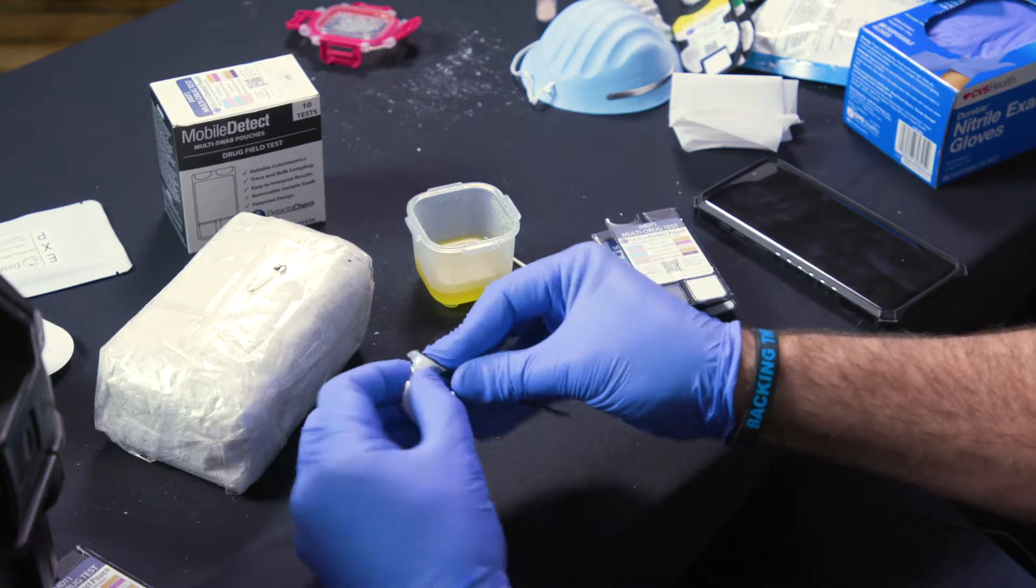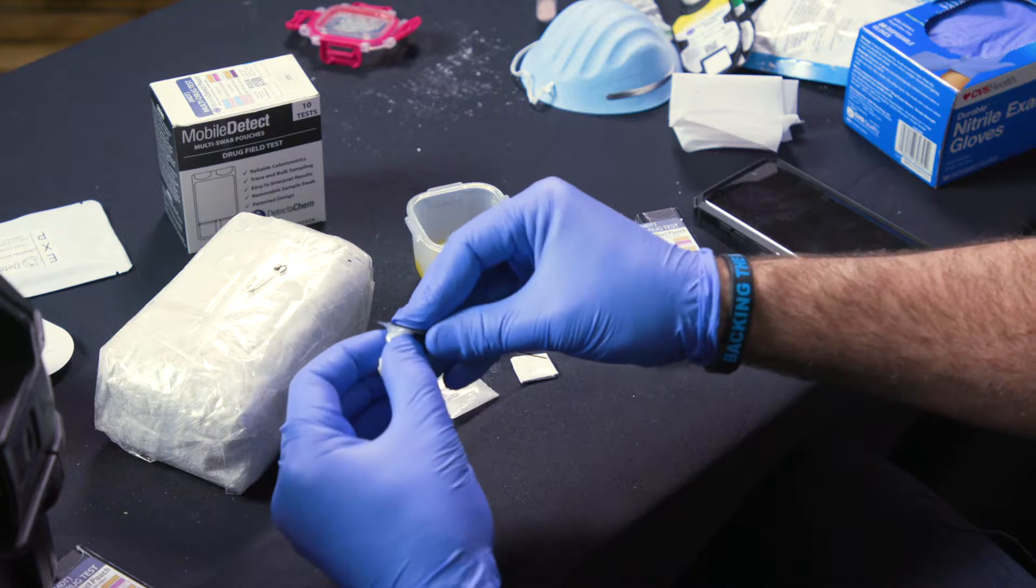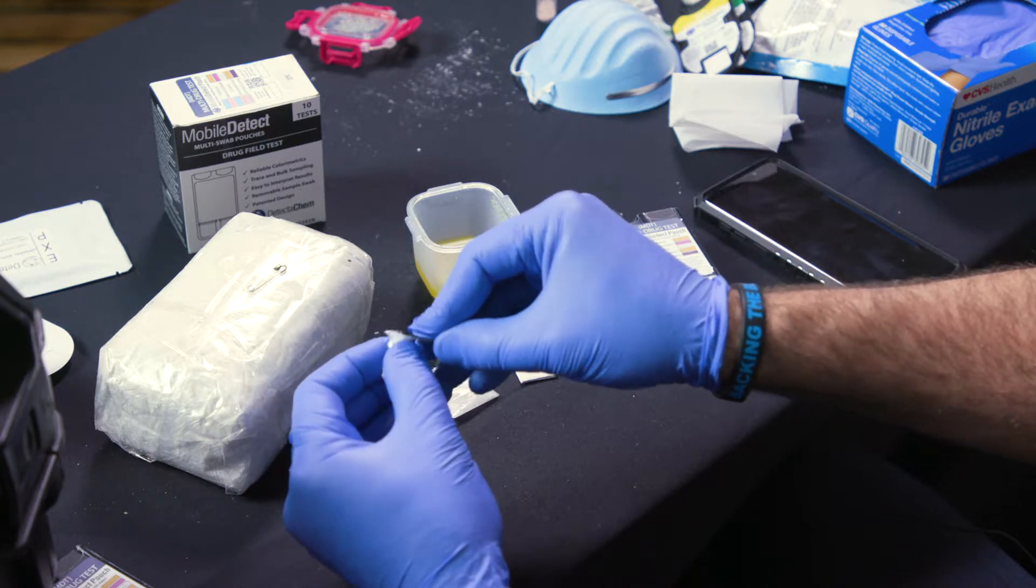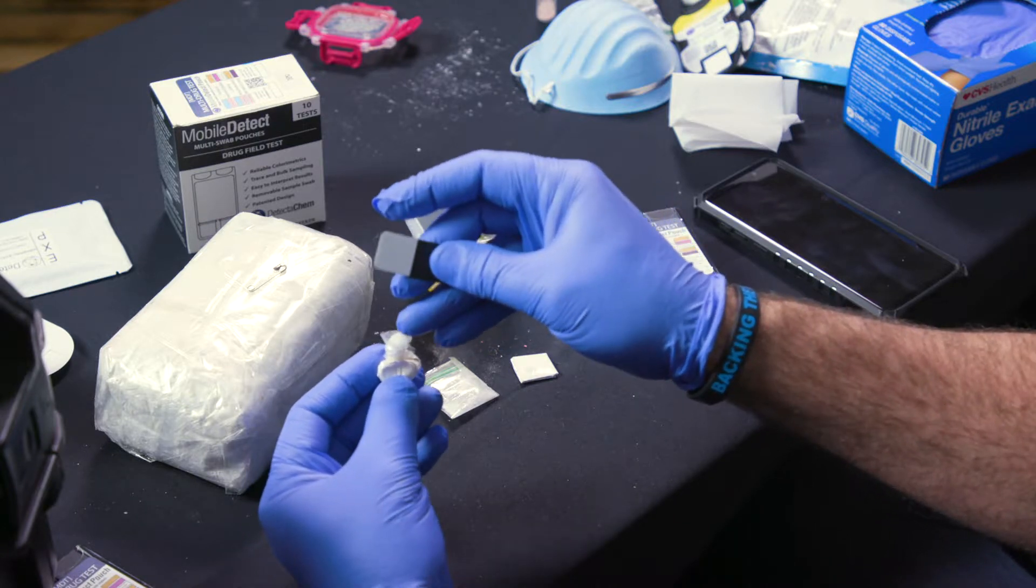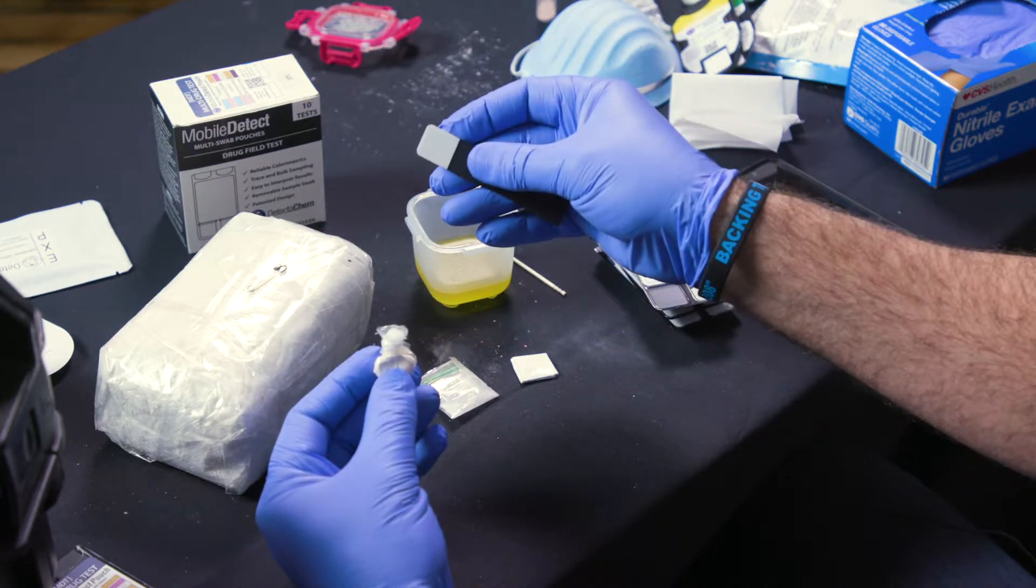Kind of twist it onto the swab like this in a circular motion. Generally there'll be enough residue from inside the package on there that you'll be able to get a detection with that.